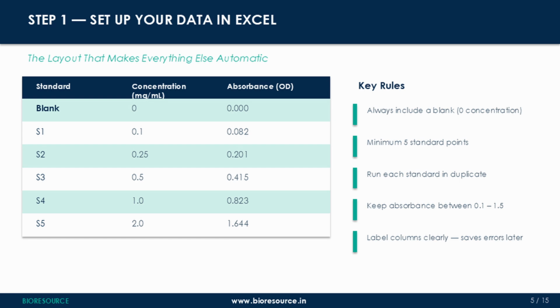Now let's look at this example. We have a blank at 0 concentration with 0 absorbance, then S1 through S5 at increasing concentration from 0.1 up to 2 milligrams per ml. A few critical rules here. First, always include your blank, 0 concentration. This anchors your curve at the origin and gives you a proper intercept. Without it, your entire regression shifts.